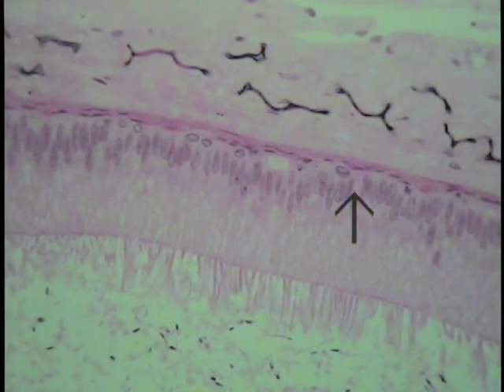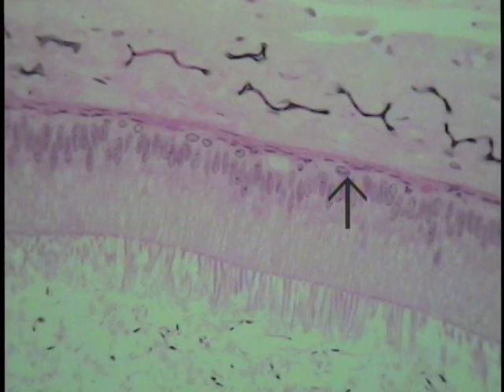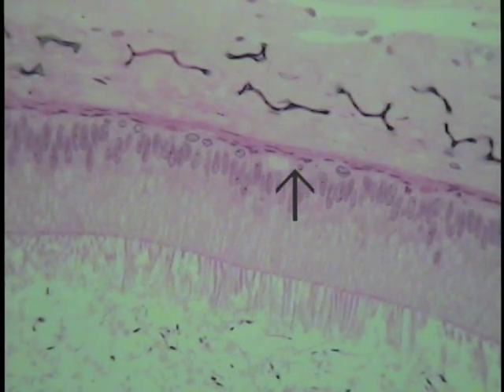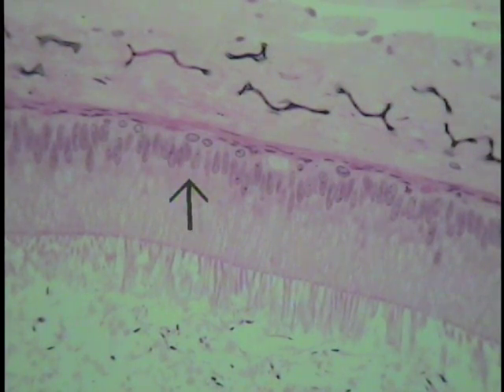The nuclear profiles are here, so you can see it as a fairly tall columnar epithelium. At least that principal cell is, extending from about where the tip of the pointer indicates to approximately this location. Also located within this epithelial layer are little round cells that hug the basement membrane. These are called basal cells, little germinal type cells that are replacement cells. Nonetheless, both touch the basement membrane.